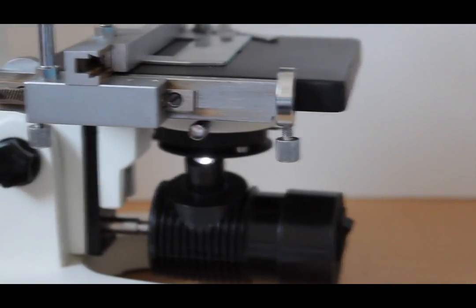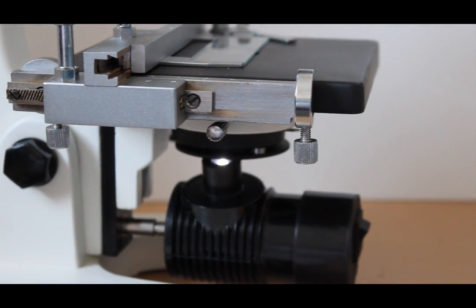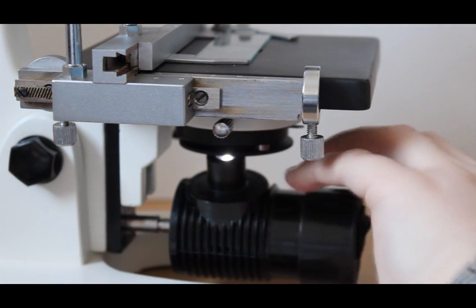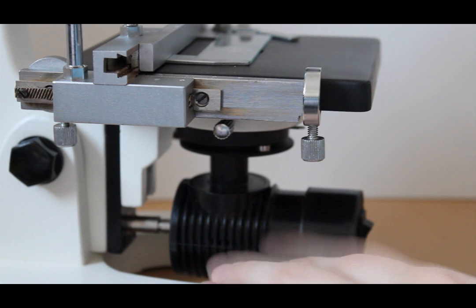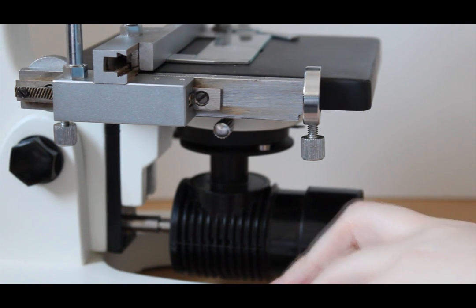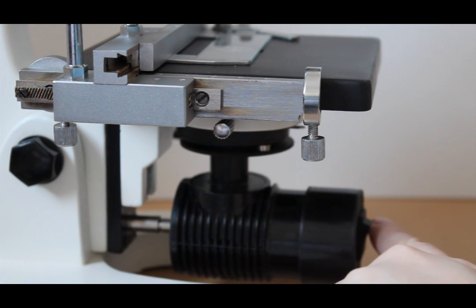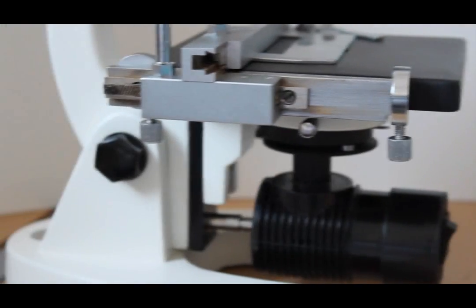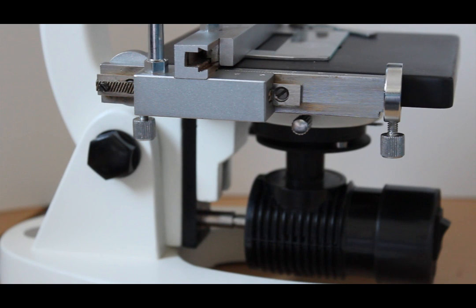Moving on further is your light source. Down here now, some microscopes will be plugged in, turned on. Either way you're going to have either a power button to your microscope light here at the front, somewhere in the back. Just carefully look for that light because obviously if you don't have any light you're not going to see your specimen very well or at all.